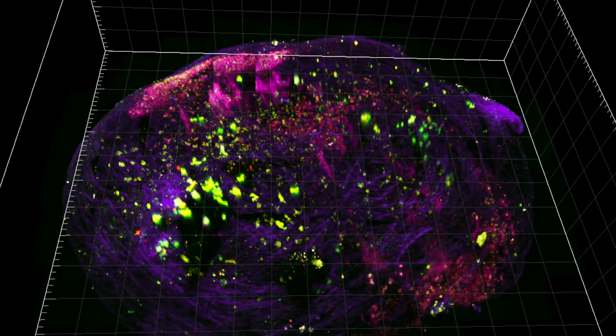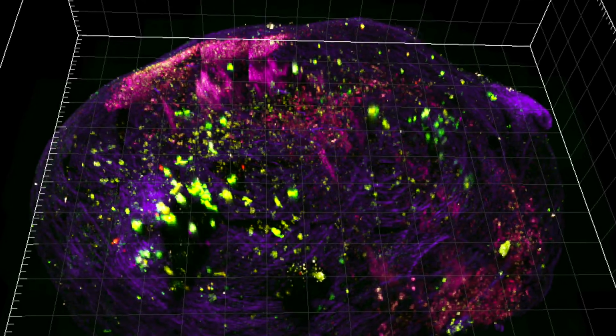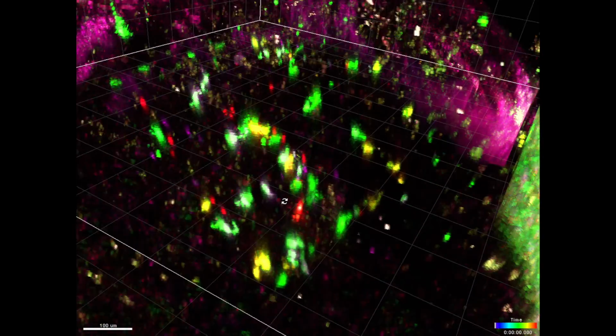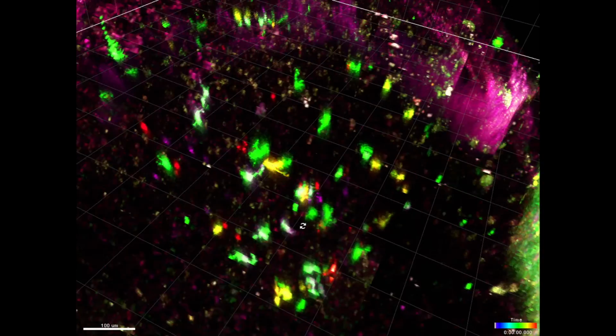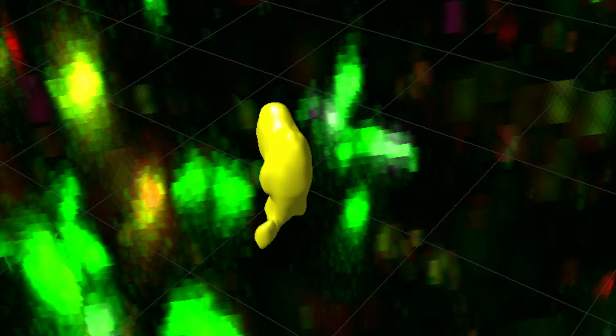Our project concerns dynamic imaging of the immune system and an application of machine learning as a data analysis strategy. Specifically, we aim to track populations of T cells, shown here in red, from hundreds of gigabytes of raw voxel data in multiple fluorescent channels. We began by running a 3D segmentation algorithm to create 2D surfaces around potential T cells.